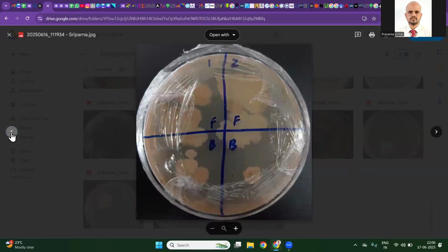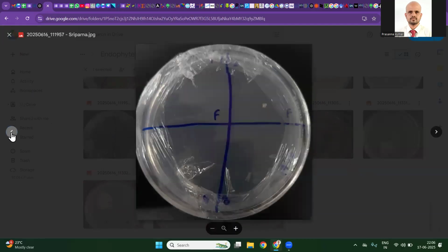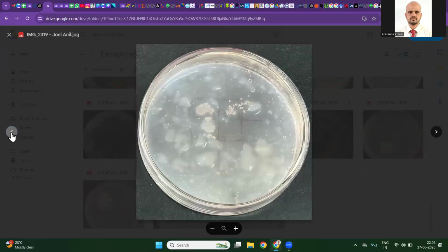Again, maybe the duration of sterilization is not enough, so the imprint also has growth here. This is relatively clean. Make sure you are not carrying the water. The imprint is not clean, as you can see. Agar solidification is also a problem here. Maybe this is the last plate you poured, where it had started solidifying.